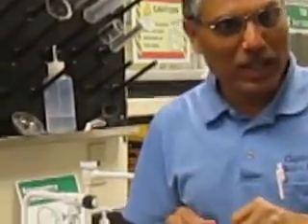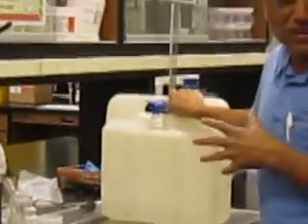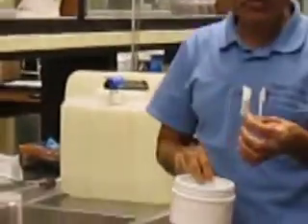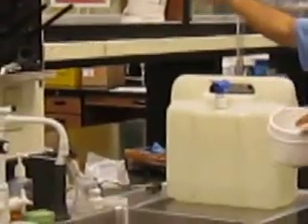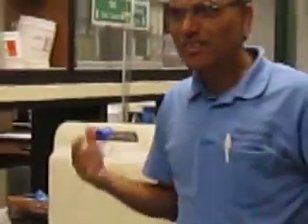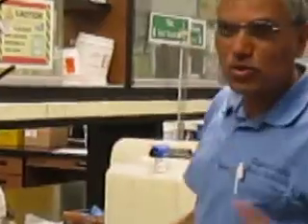We always do this with BOD water. To perform BOD, you put some nutrients in it — it's phosphate buffer, and we buy ready-made tablets. This one is for 3 liters of deionized water. Every Monday morning I make more water depending on how many samples I have — one for 3 liters and one for 6 liters. I use that to make the water, and then like a fish tank I just keep air mixing in. That water usually has 8.6 or 8.7 mg per liter dissolved oxygen.